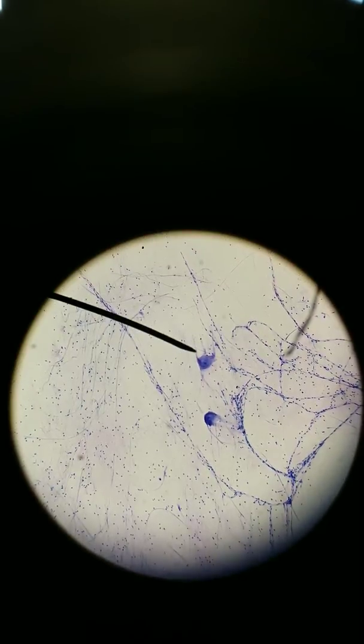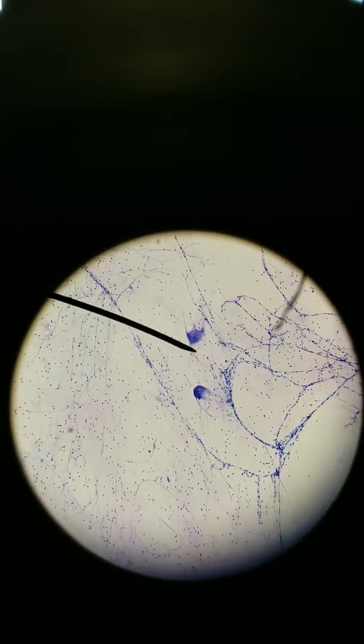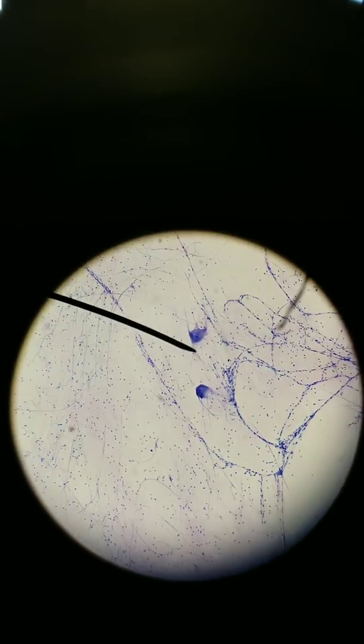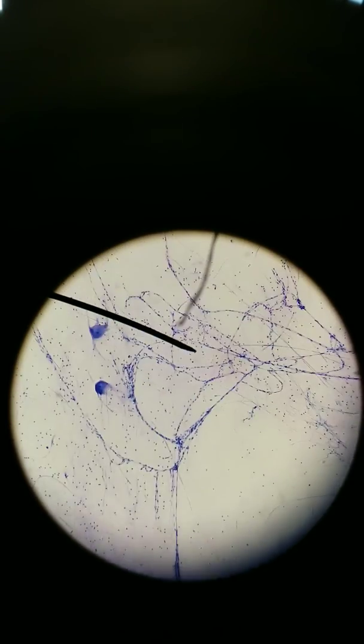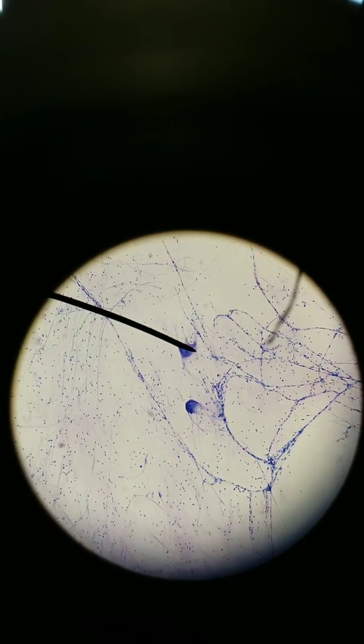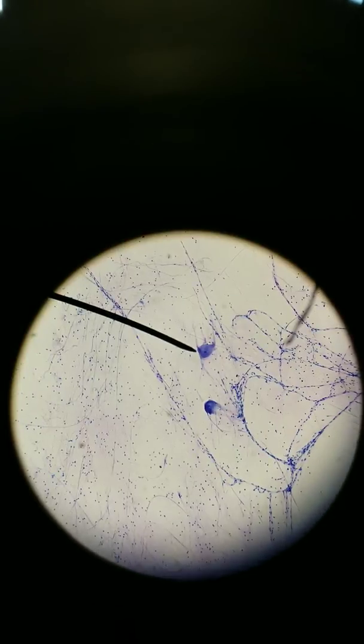These branches are dendrites and its axon is pointing out and extending to someplace else. All these long lines here, these are axons. They're really, really long. So in short, neurons are very branched, and that makes sense because of how their structure relates to their function. By being very branched, they can receive signals and send signals out. The point of the nervous system is to communicate.